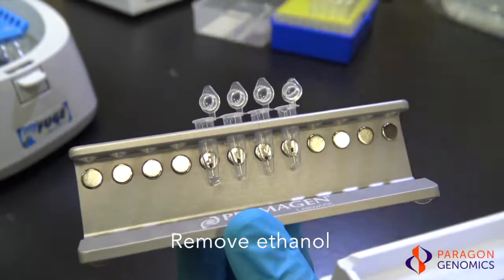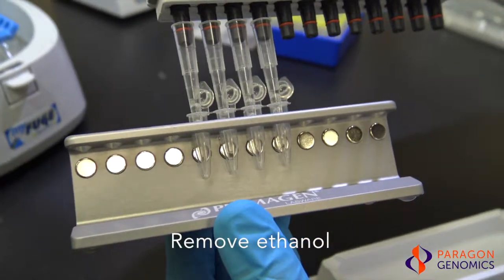Once the beads have collected onto one spot again, remove the ethanol. Repeat the wash a second time.